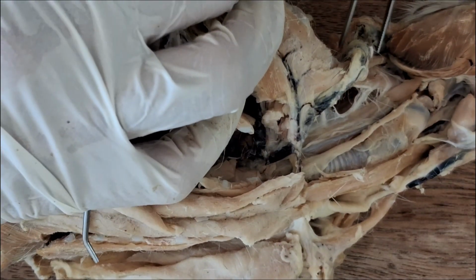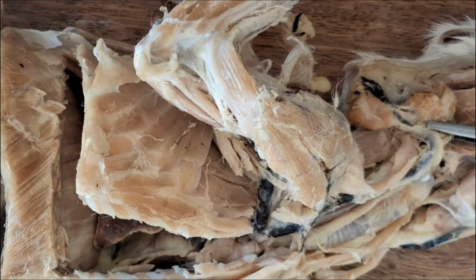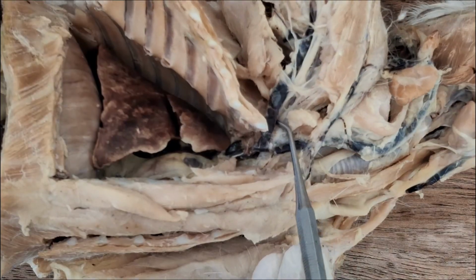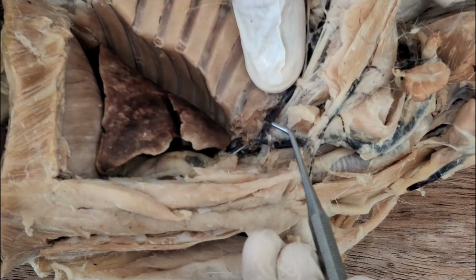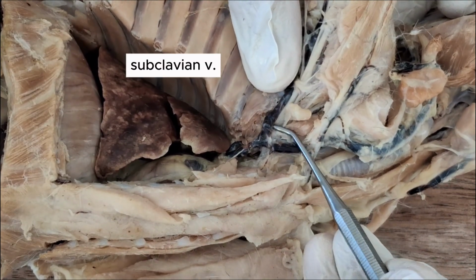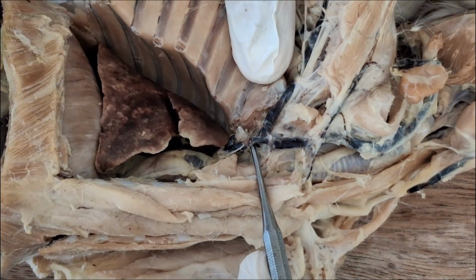So it's this large vein here on the side of the neck. External jugular. And the one going for the limb is the subclavian vein. So together they drain into the precava.